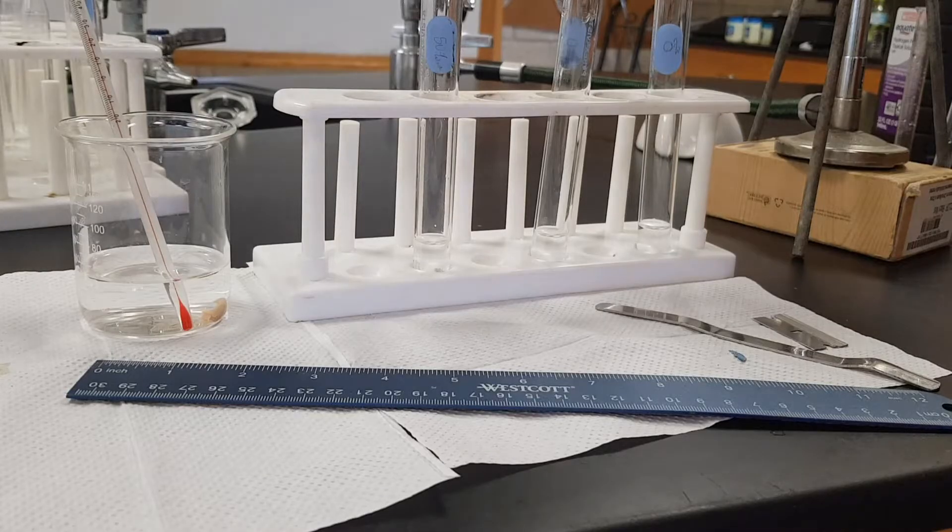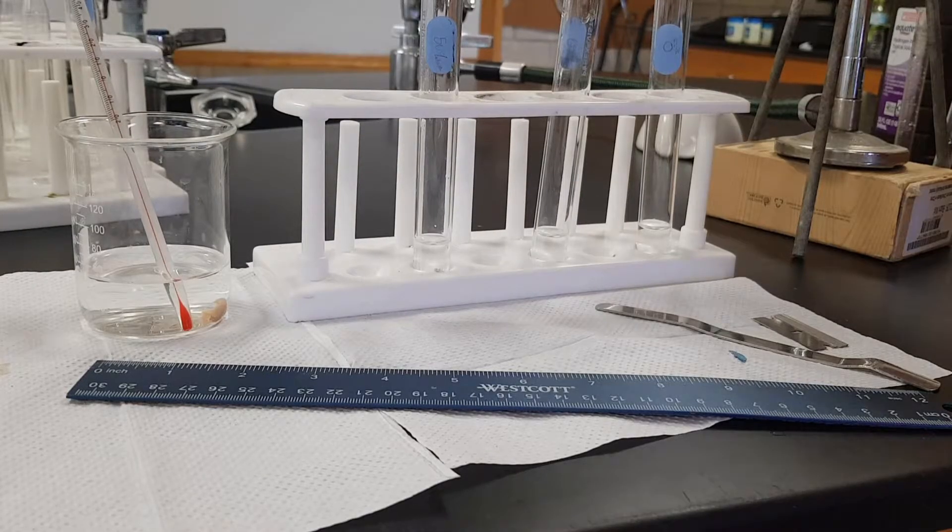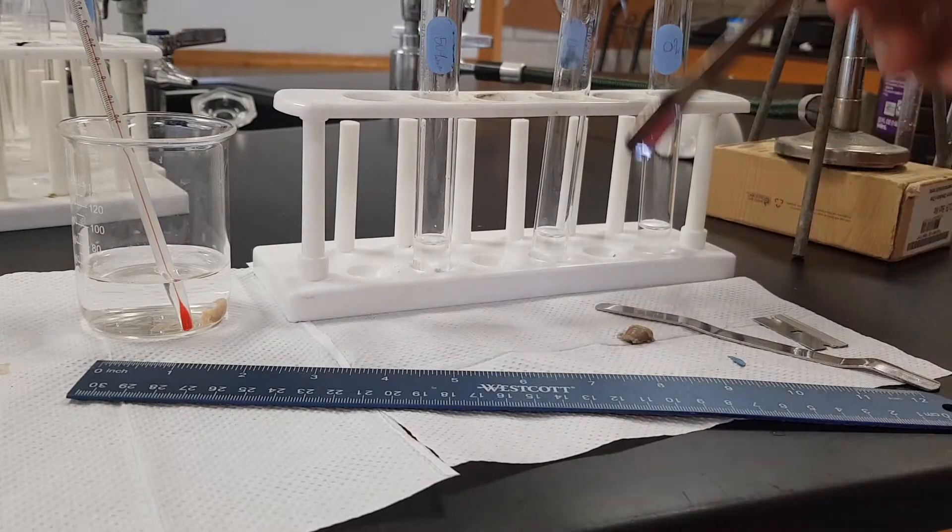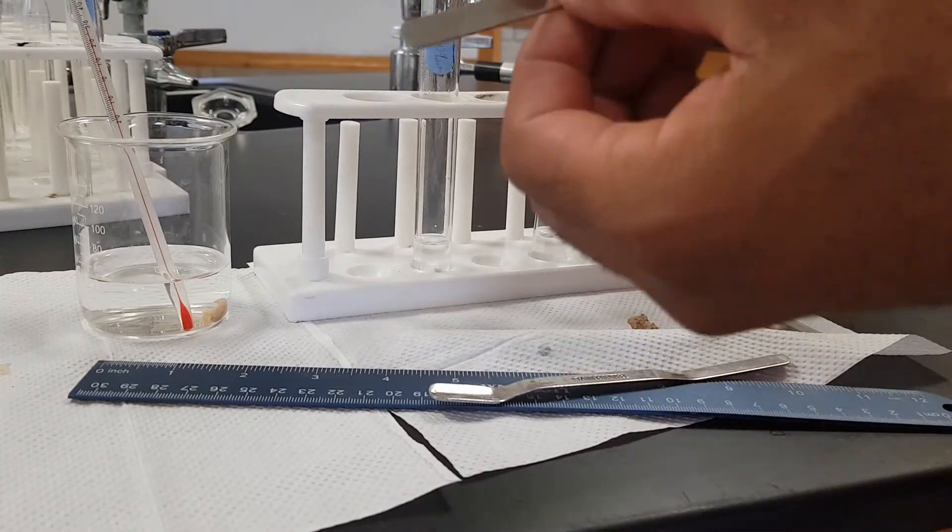The next thing you want to do is to take your liver samples from each of the different liquids.